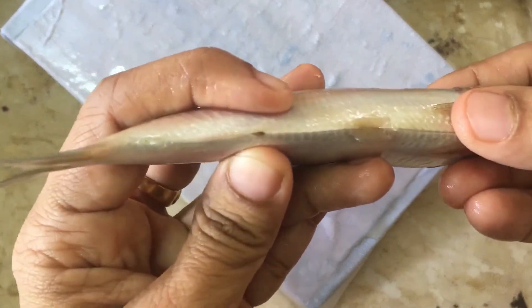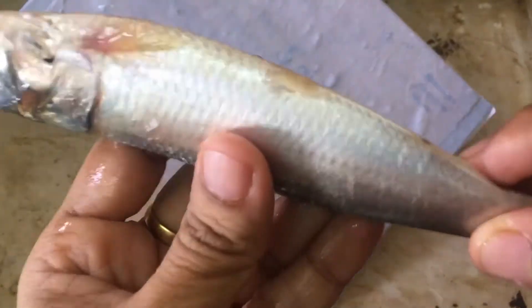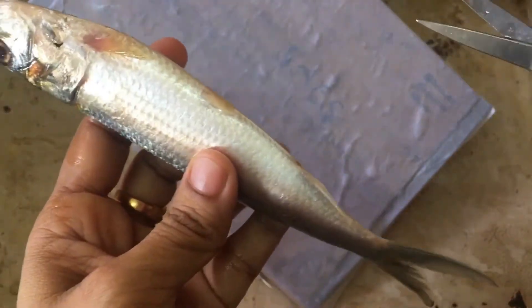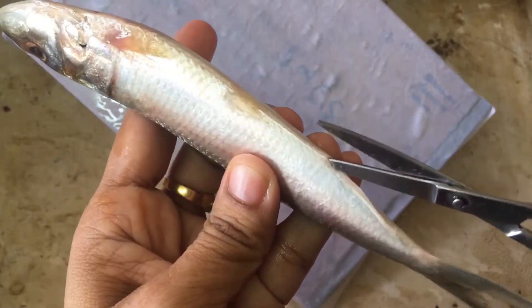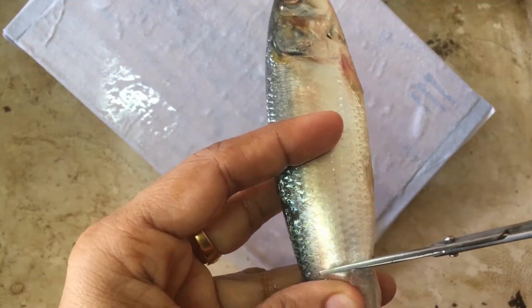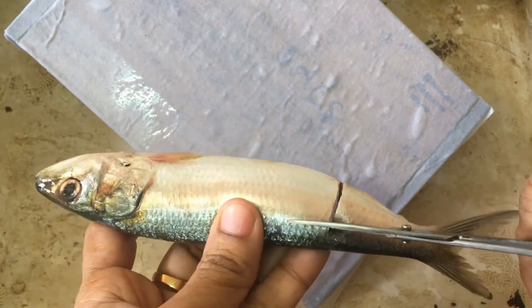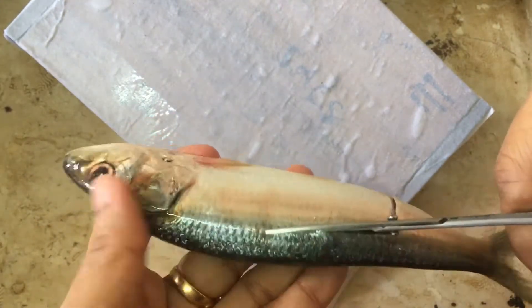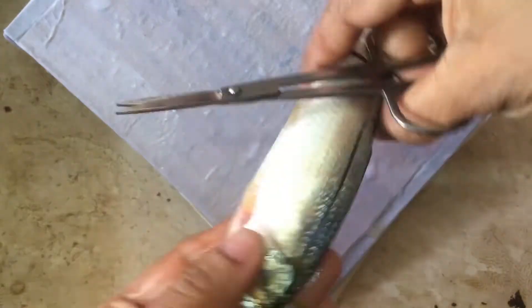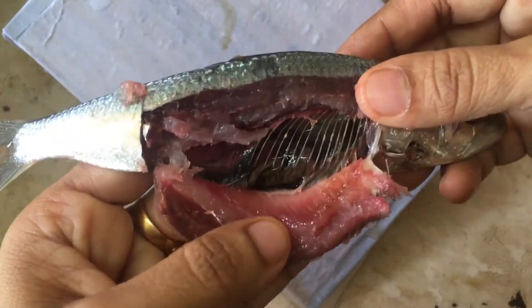I'm going to take the sardine fish. We need to start our practical from its ventral portion — from that ventral portion we need to make a window-like cut. I'm going to start that with the help of my scissor in this way. While doing that incision, we can be confident enough to cut a pretty deep incision, because only then will it cut all the flesh and bone in that region.